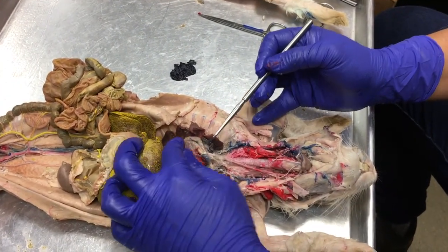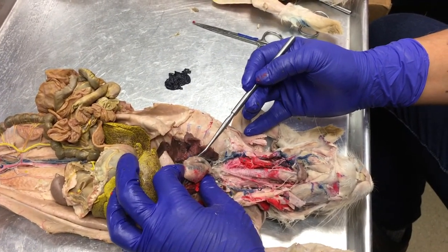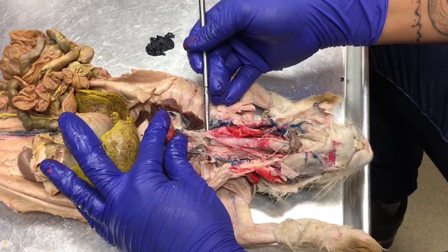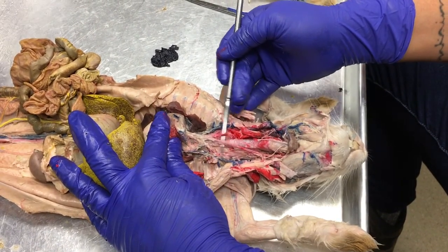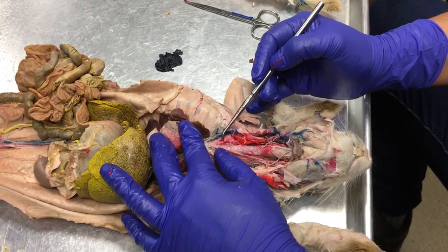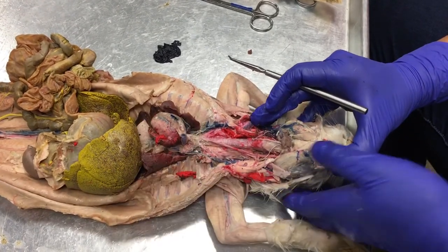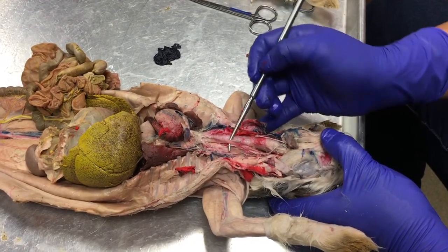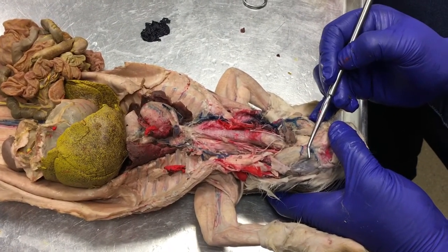Remember, our first tributary off the arch of the aorta is not visible, but we can see the coronary arteries on the surface of the heart. Our first visible branch, though, is this big branch right here. The first two tributaries off of there are your common carotid arteries. The common carotids are going to follow just lateral to the trachea, so you'll be able to see them. What you want to do is take one of these common carotid arteries and follow it up to where your masseter muscle is.